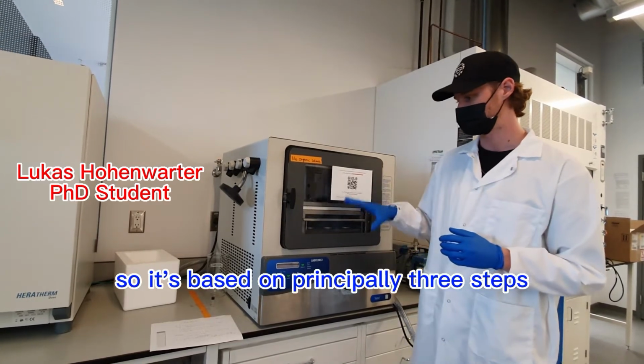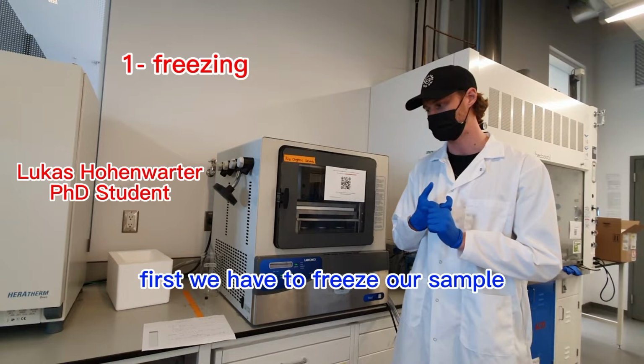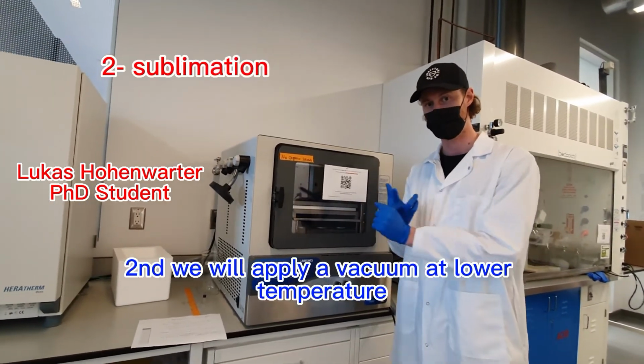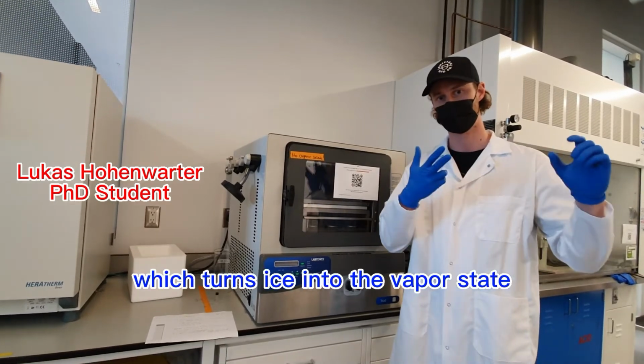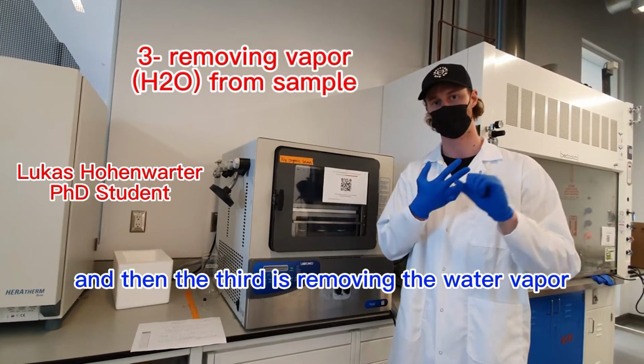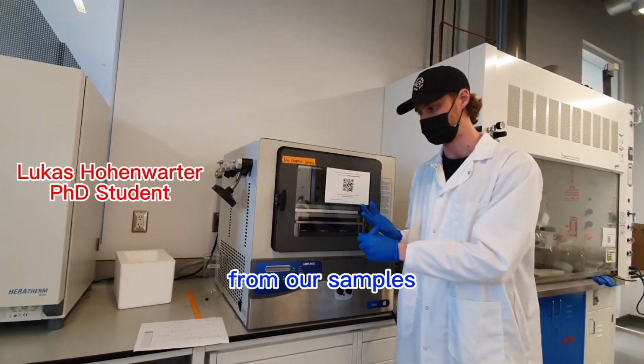It's based on principally three steps. First, we have to freeze our sample. Second, we will apply a vacuum at low temperature, which turns ice into this vapor state. And then the third is removing the water vapor from our samples.